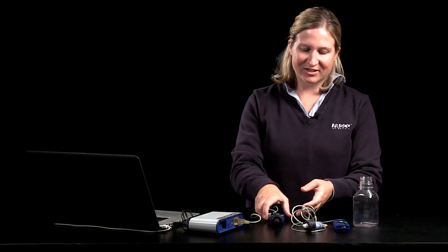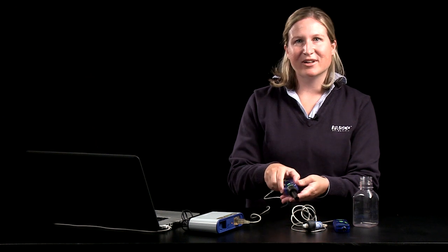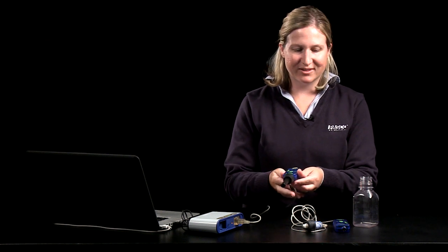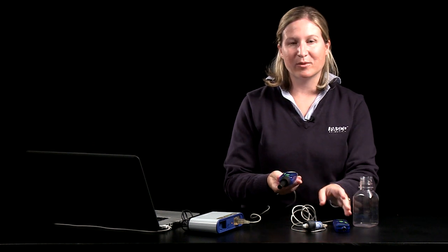Hello, thank you for joining me today. My name is Cynthia Sargent and in today's video we'll be looking at the carbon dioxide and oxygen gas sensors. You can use these for a number of activities in your classroom and just a basic introduction to the sensors and calibration.